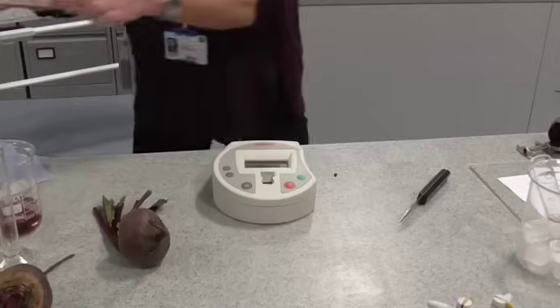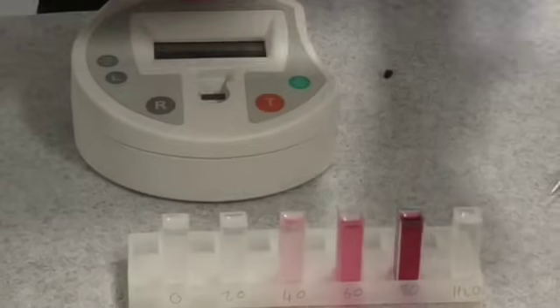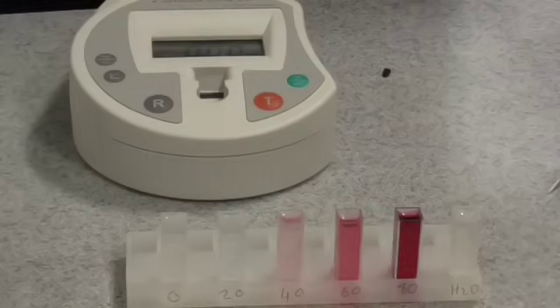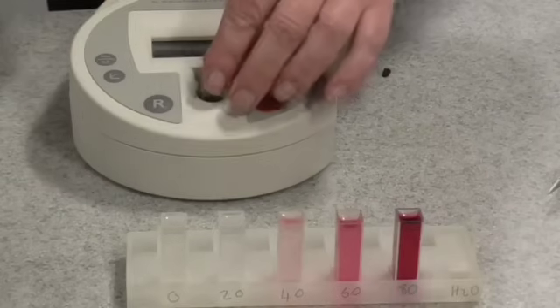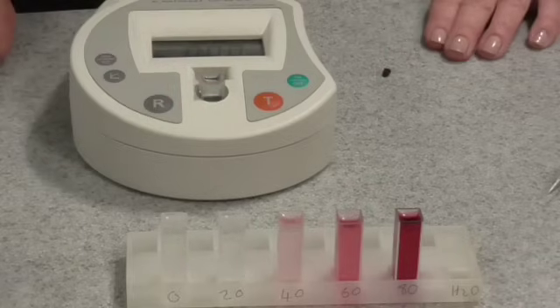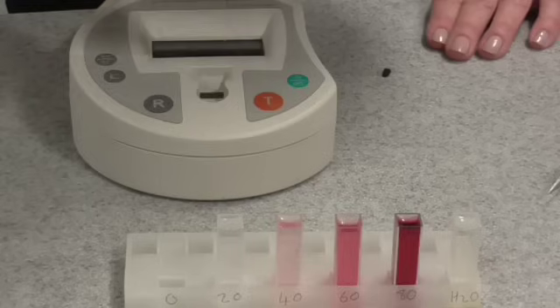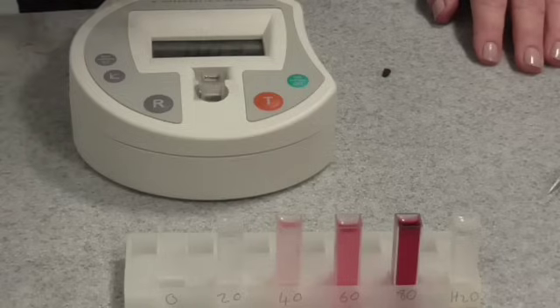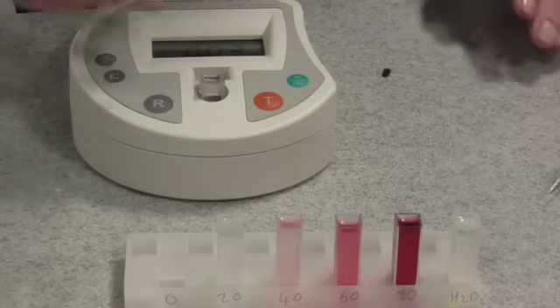I've taken the beetroot out of the tubes and decanted some of the liquid into different cuvettes — these are the little cuvettes we're going to place in the colorimeter. Before we start, we have to set the colorimeter to zero using distilled water. We place that in, press the R button, and that resets or re-zeroes it. Once we've done that, we can go along our range — starting with the zero degrees from the ice bath — press test, and that gives us a value of the percentage of light being absorbed by the anthocyanin in the sample.